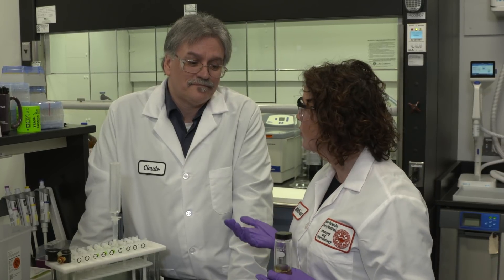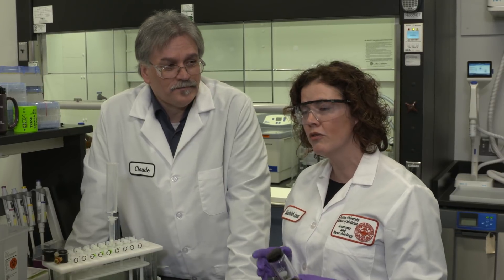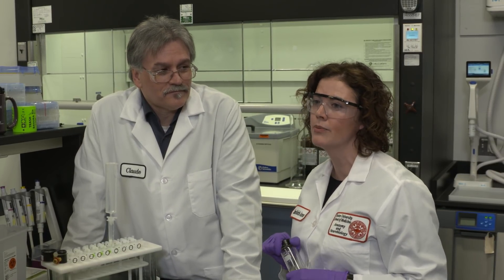It looks like the myth has been demystified and that multidimensional chromatography really isn't that hard. After I adopted the technology, we've actually worked together with a number of graduate students from Boston University to utilize and optimize methods for multidimensional liquid chromatography. So let's go to the whiteboard and take a look at some data.